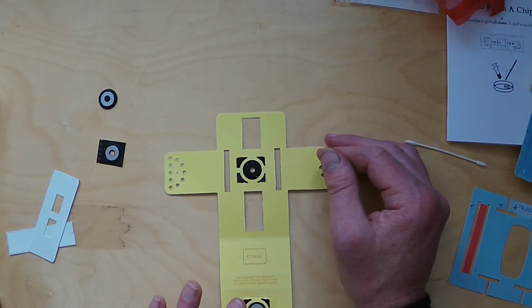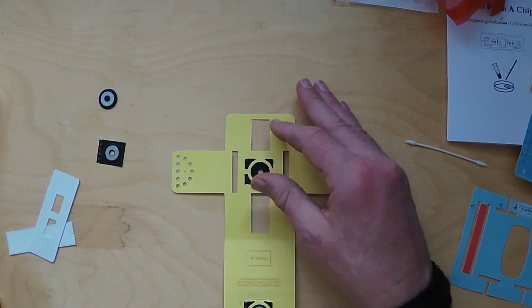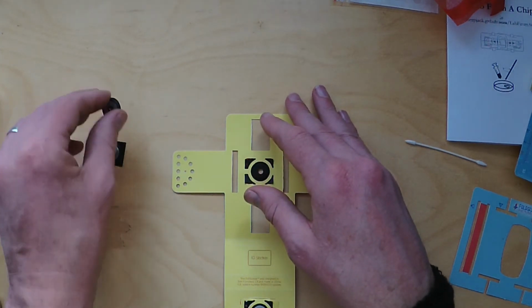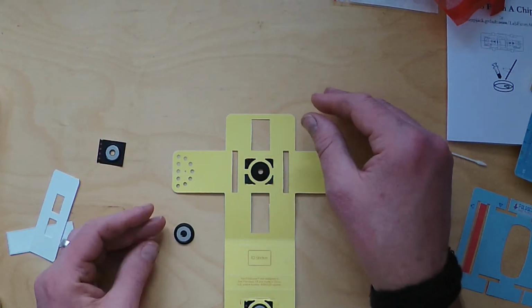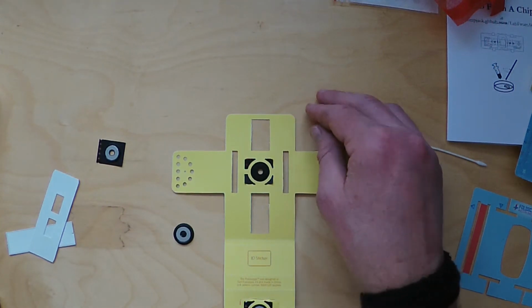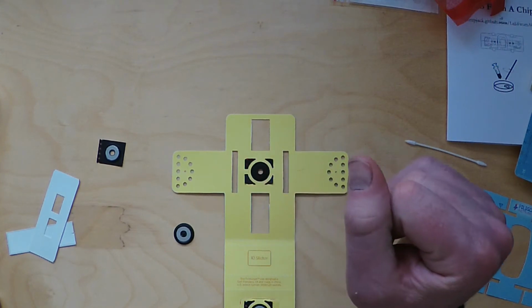Okay, the next step is inserting the lens into the actual lens stage. So here's our lens that we separated off earlier. Bear with me while I just triple check the instructions because this is the point you want to get this correct, basically.